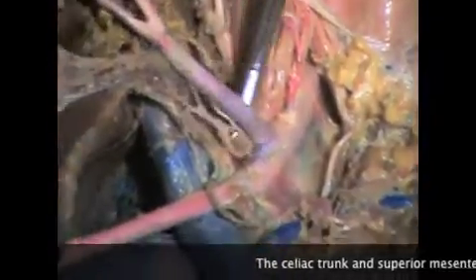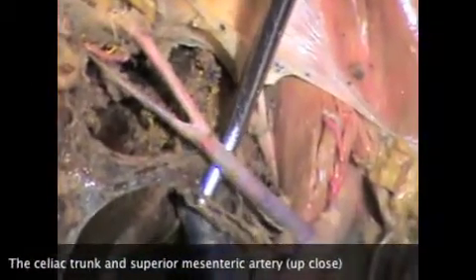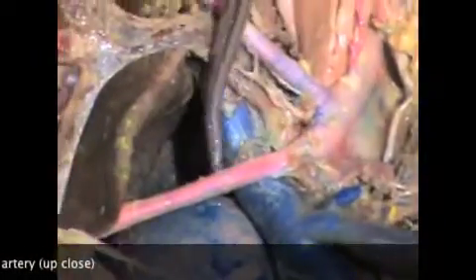Here we see the abdominal aorta with the celiac trunk branching off of it right away. This is a close-up view of the celiac trunk. Just beyond that, caudally, we find a very large artery right here. This is the superior mesenteric artery. The superior mesenteric artery serves the small intestine as well as portions of the large intestine.